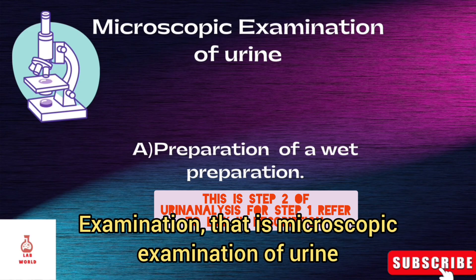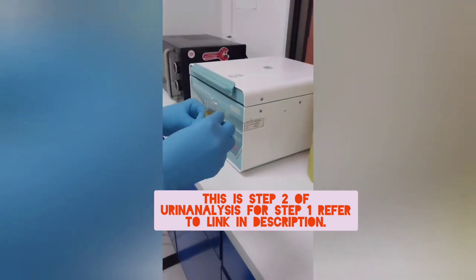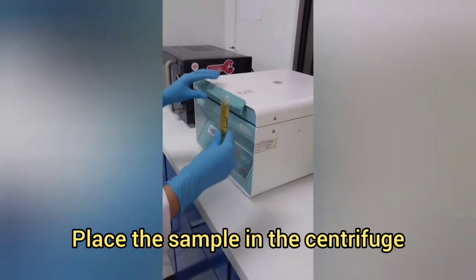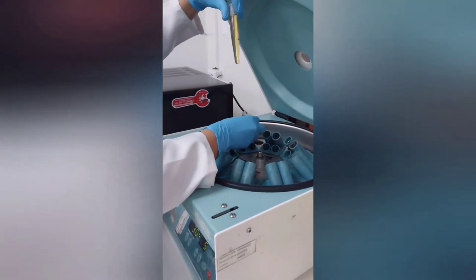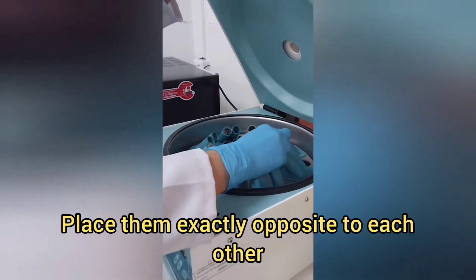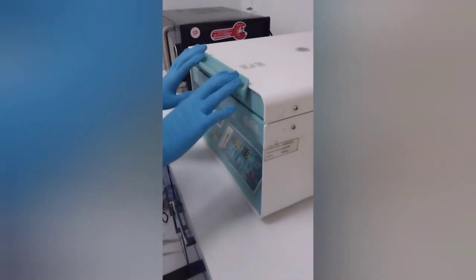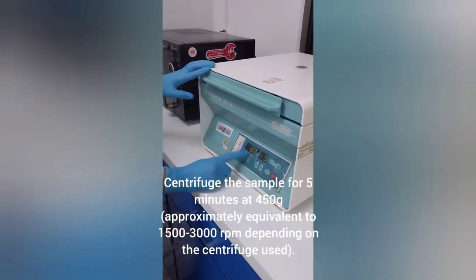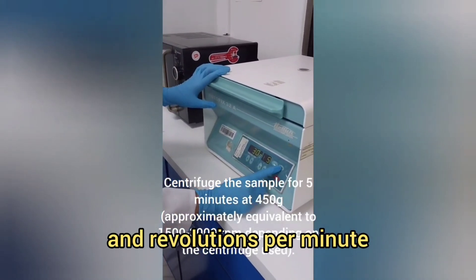Microscopic examination of urine. Let us start. Place the sample in the centrifuge and balance it within equal volume tubes, placing them exactly opposite to each other. Set the time and revolutions per minute.